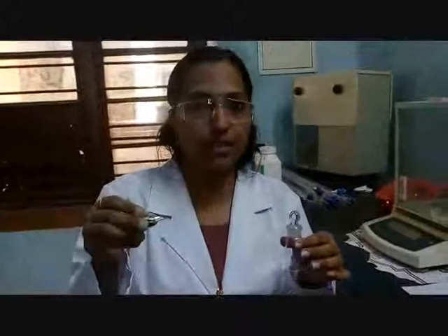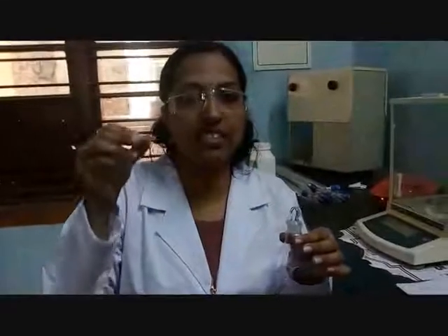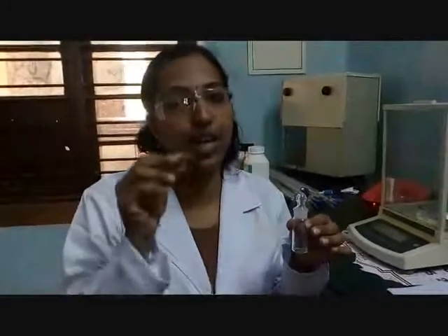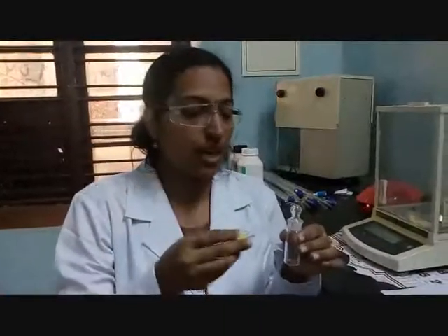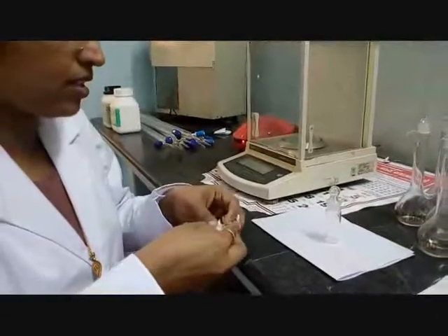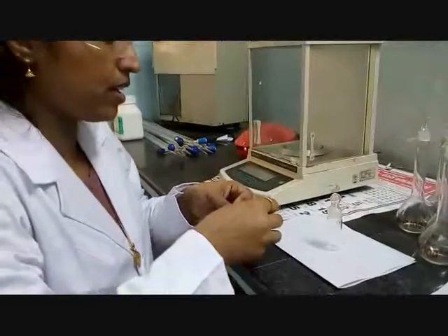Now I am going to transfer this Na₂CO₃. This is a rough weight of Na₂CO₃. I want to find out the accurate weight of Na₂CO₃. For that, I am first transferring this Na₂CO₃ — the rough weight — into this weighing bottle.